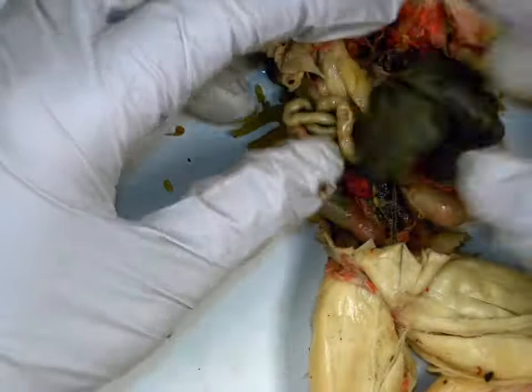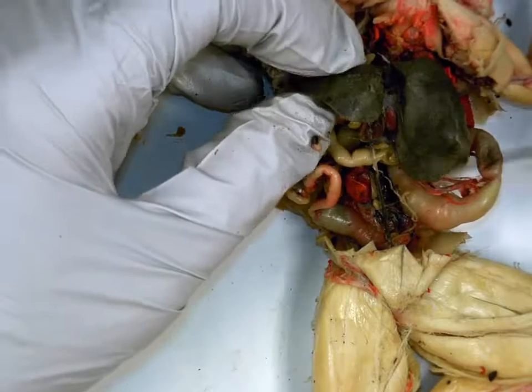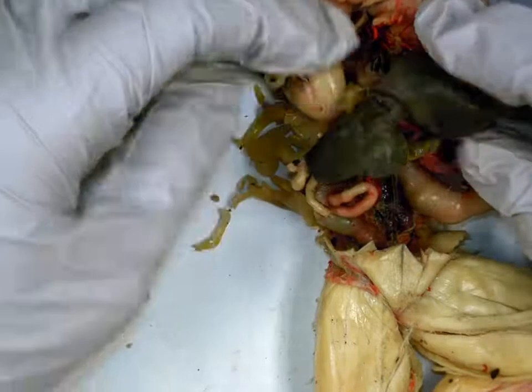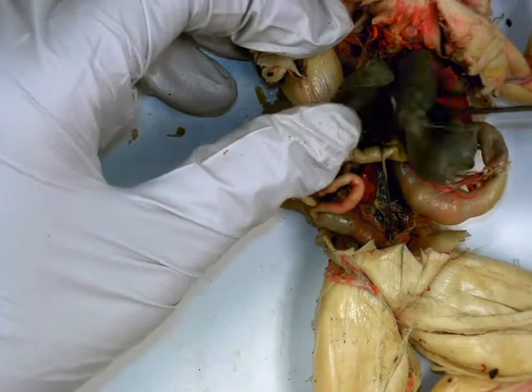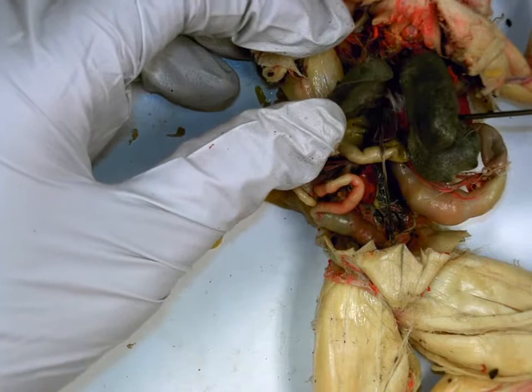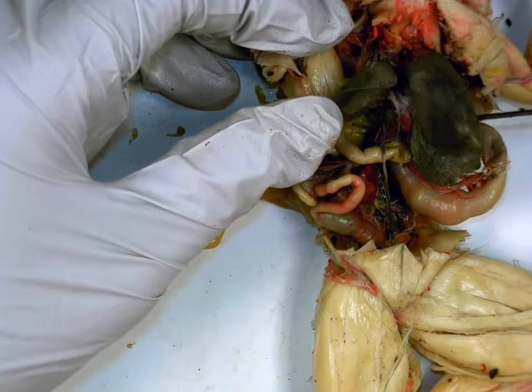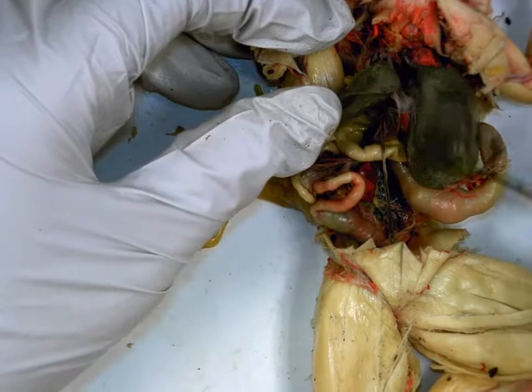Now let's go back up. What are these three dark things here? Liver. Liver has how many functions? One would be? Produce bile. Another one? Store nutrients. Another one? Remove metabolic waste. Sorry, 4 was in the shark. So just 3.